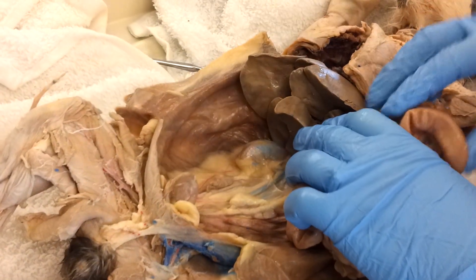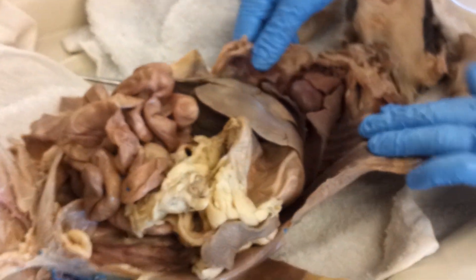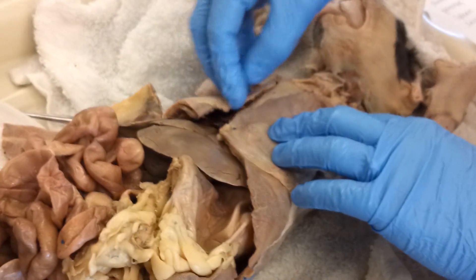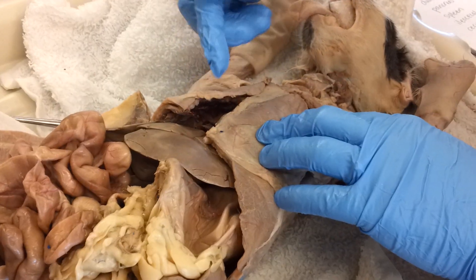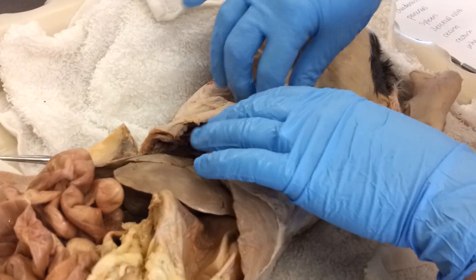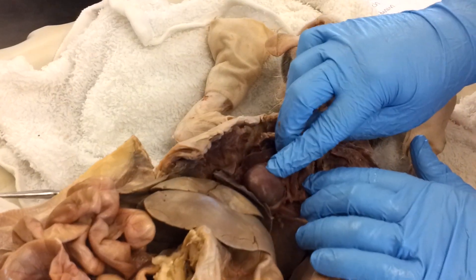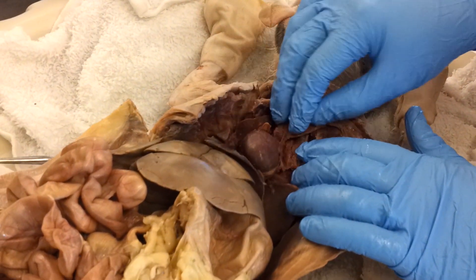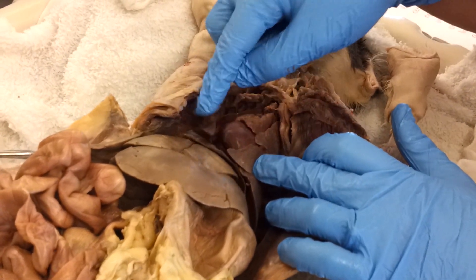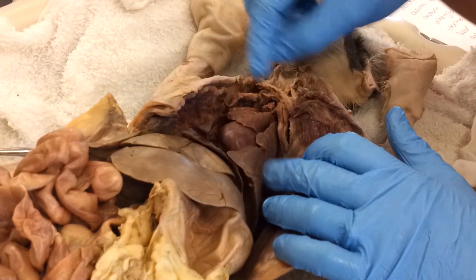Now let's look up in the thoracic area of this cat. To cut this part, students had to use bone cutters. Don't go right along the middle or you'll be cutting through the sternum — use bone cutters to cut just off center of the sternum and up all the way into the neck. We can at least see the heart right here, normally covered with the pericardial sac, and it looks like part of that has been removed in this cat. Then the lungs — just as the cat has more lobes to its liver, it also has more lobes to its lungs, which makes that look a little bit different than in the human.